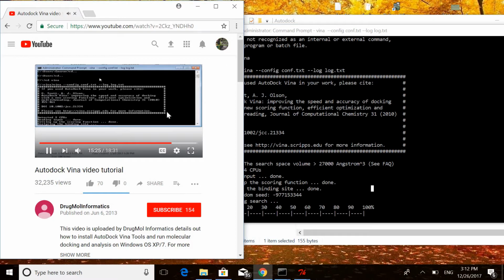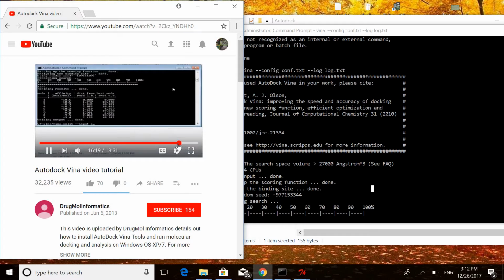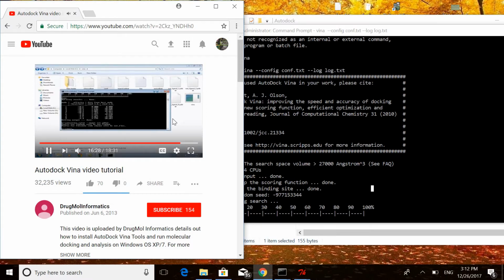Vina software will split all these 9 docked conformations from the single file that is out.pdbqt. Now you can see the different conformations.